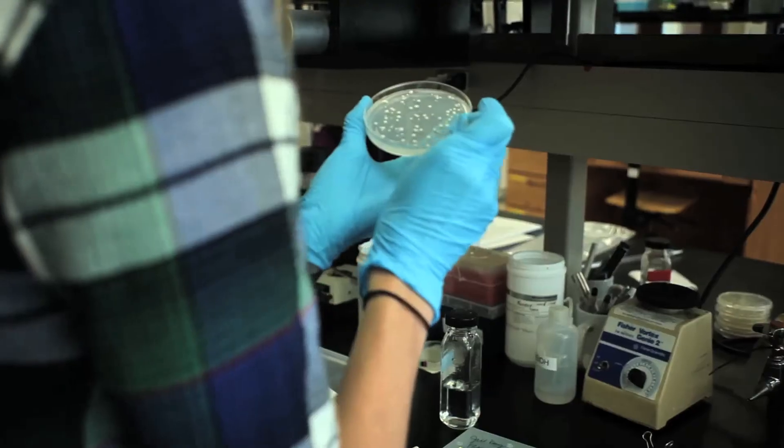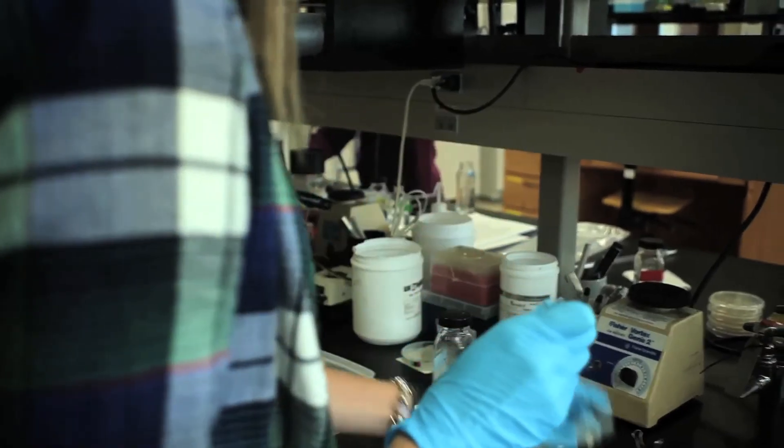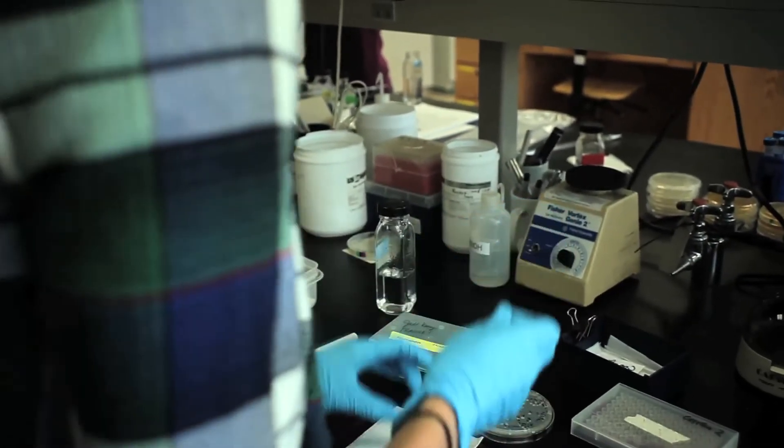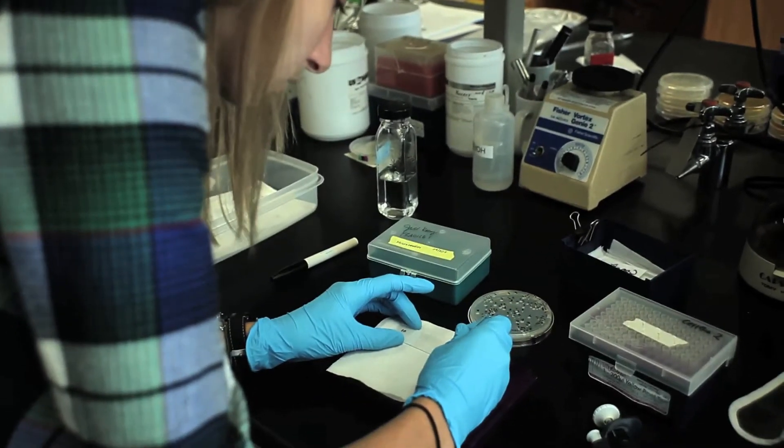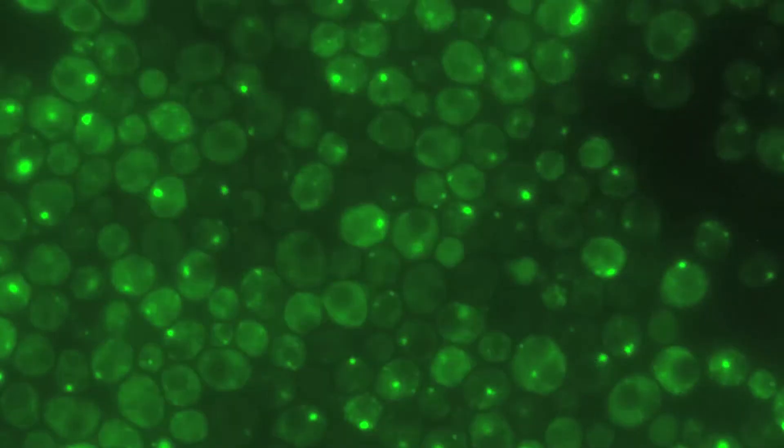The students are doing all the research work. We've been doing a lot of following the proteins within the yeast cell. We tag the proteins with fluorescent markers, so they actually look like they glow under the microscope — they light up, they look fluorescent — and so we can follow where they're at in the cell. So they do a lot of fluorescence microscopy.